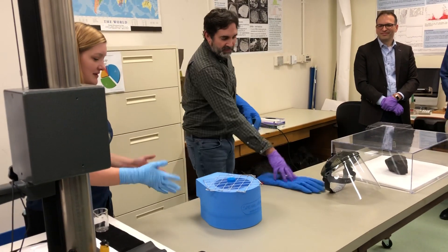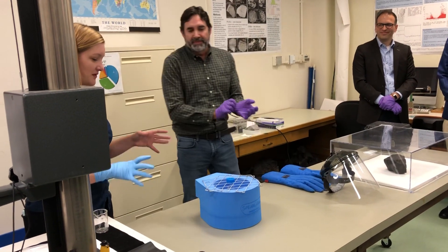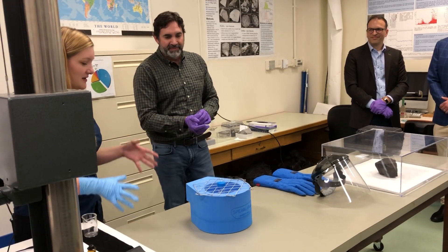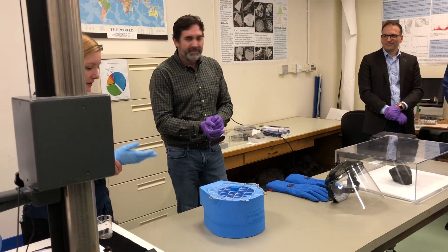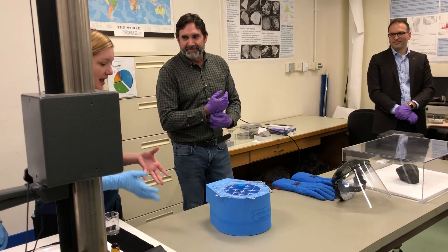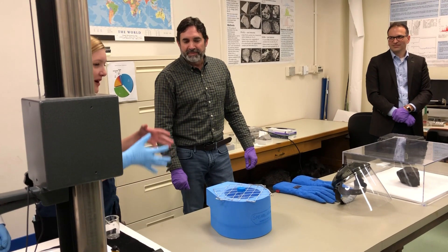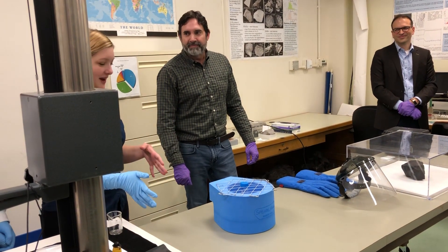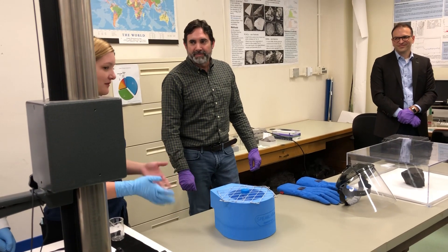By doing this just once, we're not going to take it out except when we really need to. This really helps preserve the meteorite, especially the volatiles. Phillip said that this was a hypervolatile meteorite, and you can actually measure the amount of volatiles that a meteorite loses by weighing it before and after. We've actually already seen that loss in samples that haven't been cryogenically frozen.